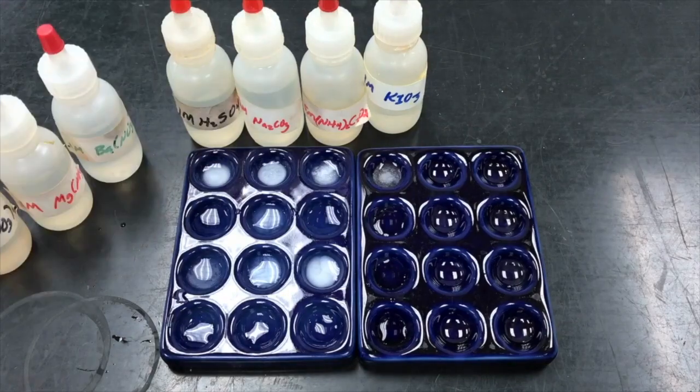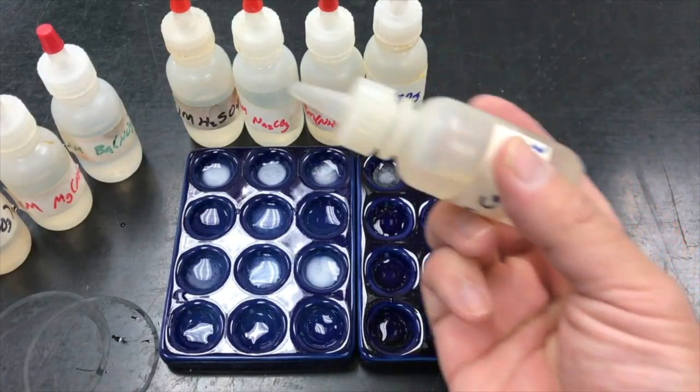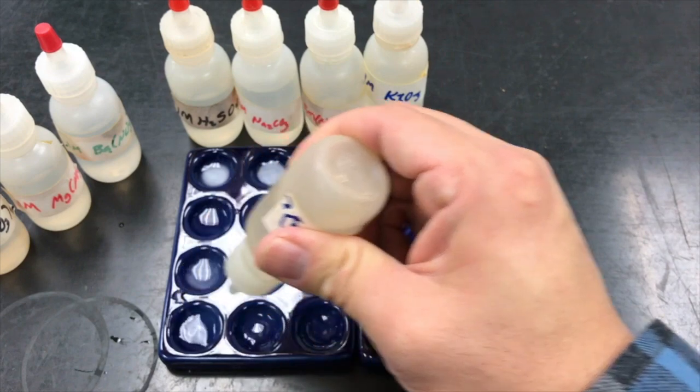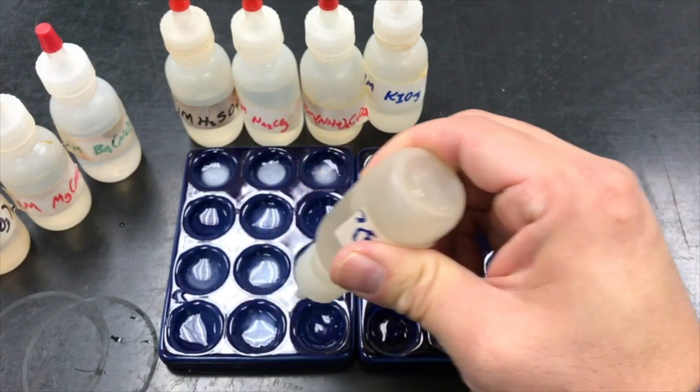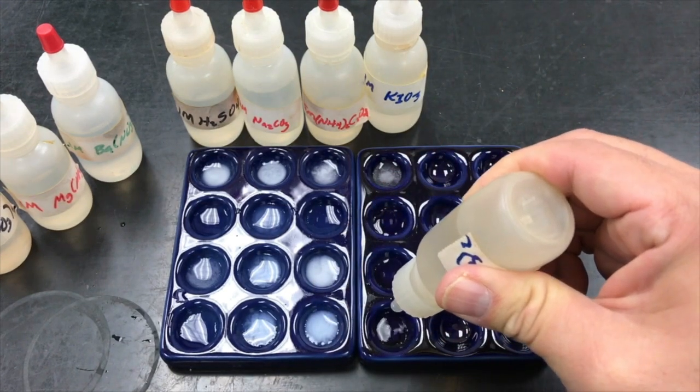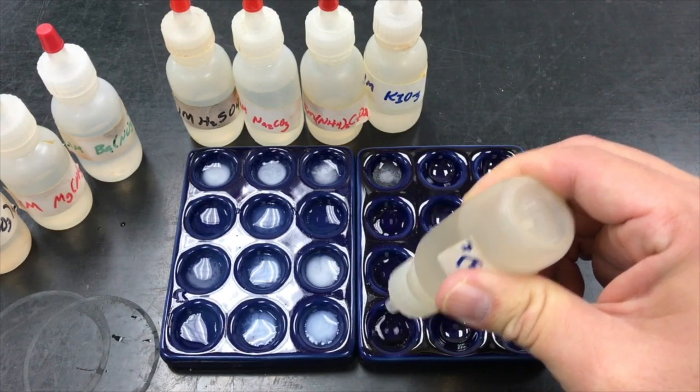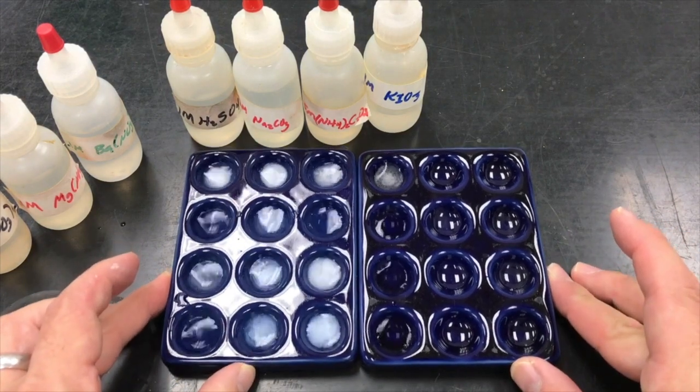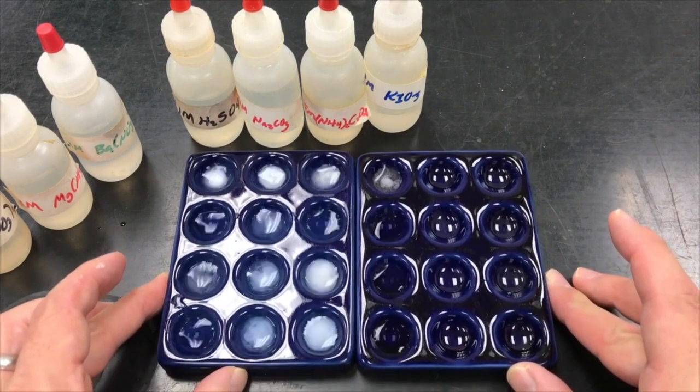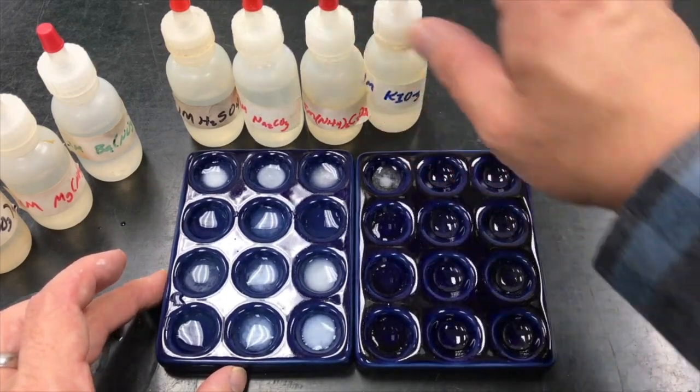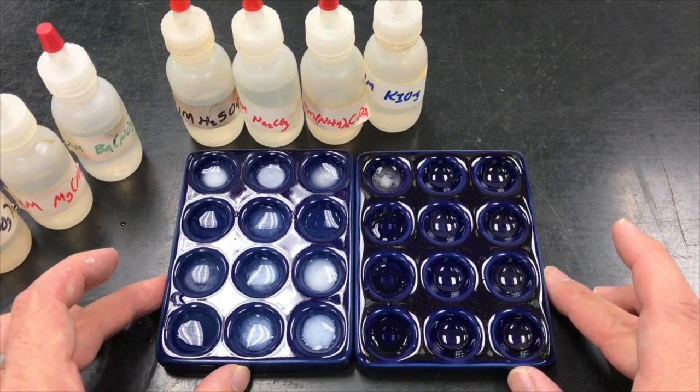Our fourth row will be with the calcium. And our calcium precipitates just with the sodium carbonate and the ammonium oxalate.